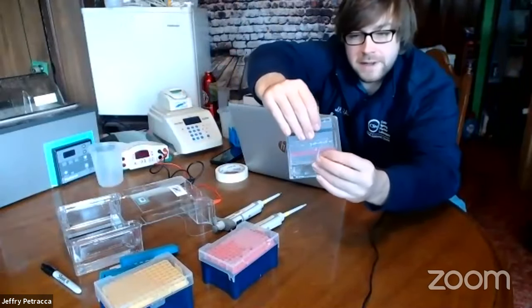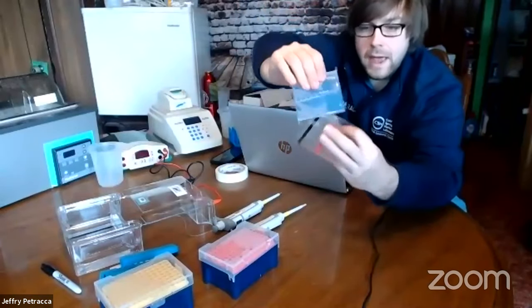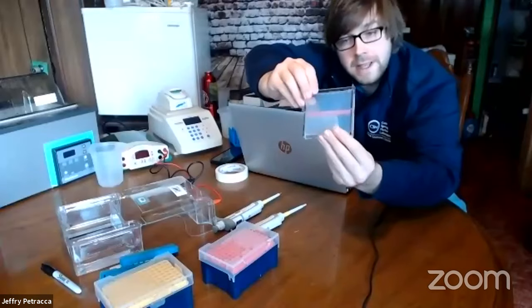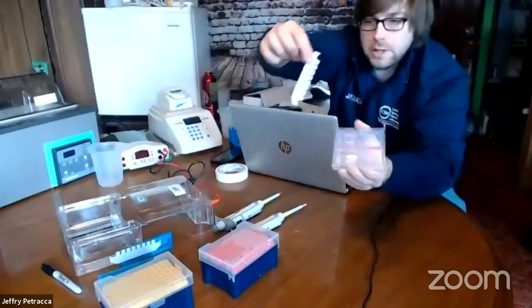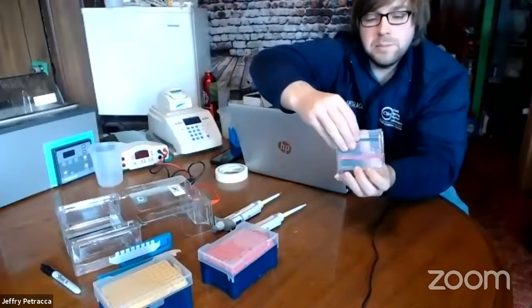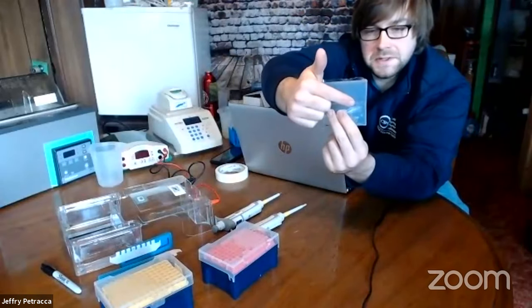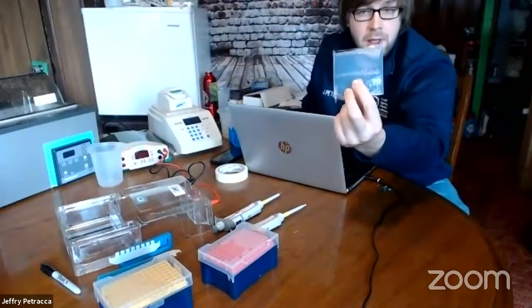This is basically just fancy science jello — that's all it is. This is a casting tray, sort of like a jello mold. I warmed up some agarose, got it hot, and poured it into this casting tray. I used these little tools called combs, which left behind little depressions in the gel. Those are called wells — depressions where our samples are actually going to get loaded today. This is a double comb gel, meaning there are 16 wells.